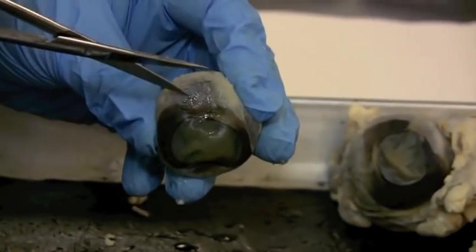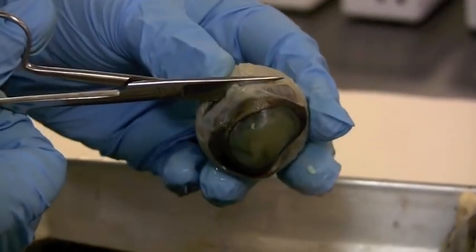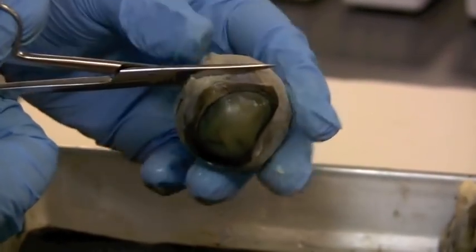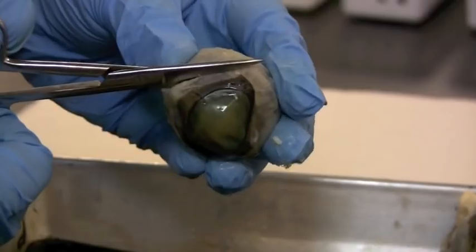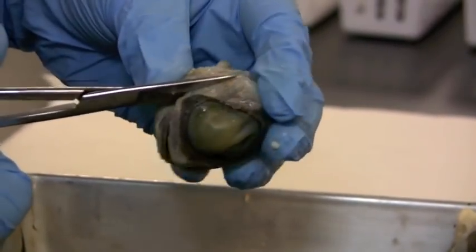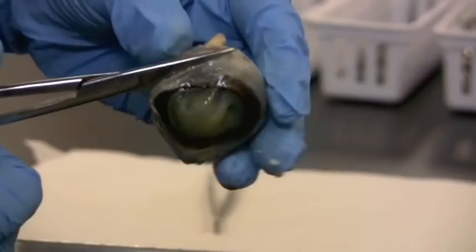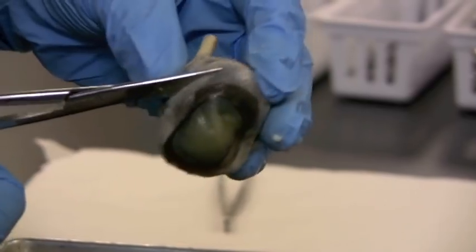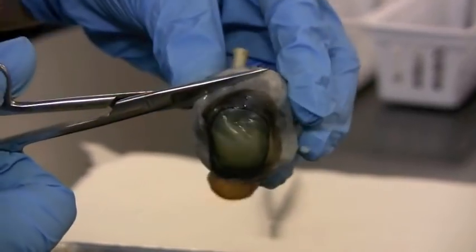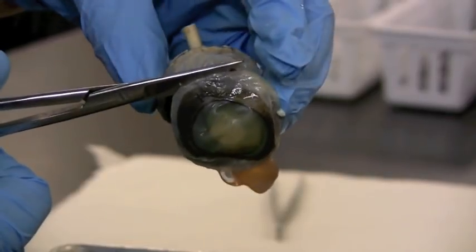I'm going to go ahead and use the scissors now to continue my circle. A little hard to cut through all of these layers, and I'm not making a perfect cut, I'm sure, but generally... I'm leaking out some humors here... continuing in a circle.